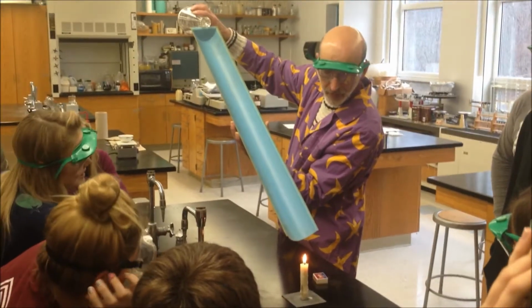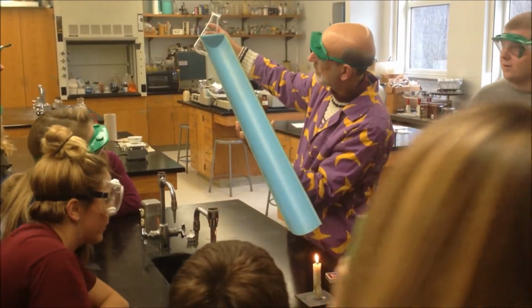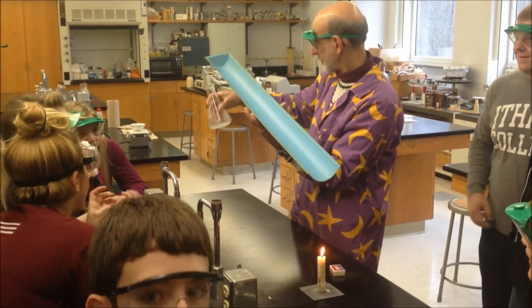Oh my God, I see the gas going down. You see it going down? I see the gas going down. Oh my God, she sees it. Okay, did you see that? I didn't see it. All right, I'm going to do it again. I saw the gas going down. I don't know. I can't see it.